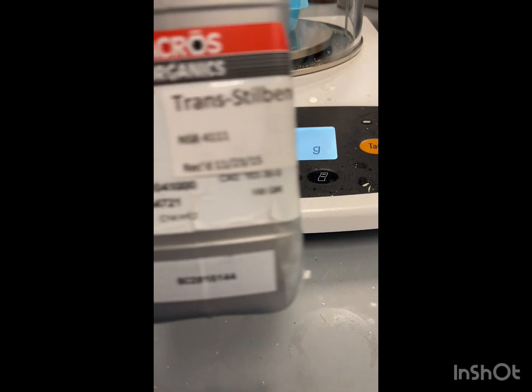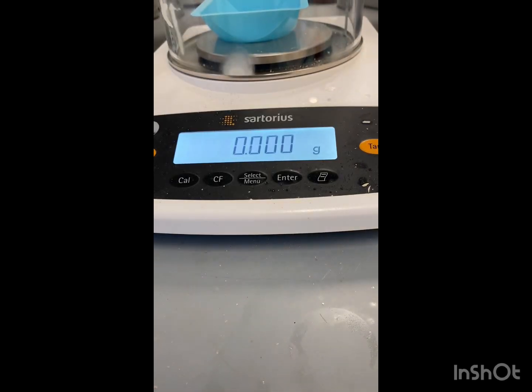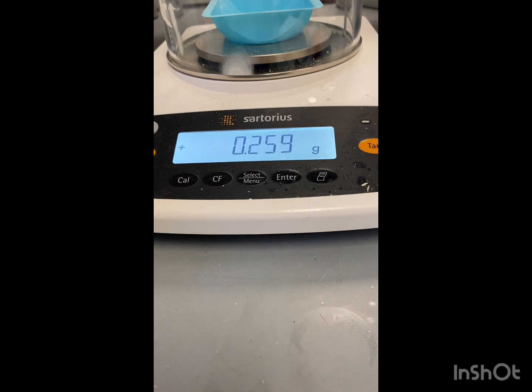So here is our transtilbene. All right, so we got 0.259 grams of transtilbene.